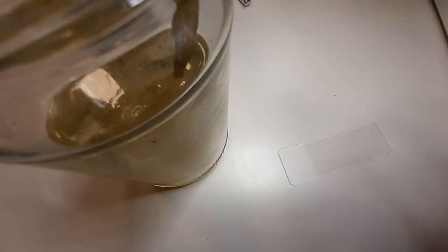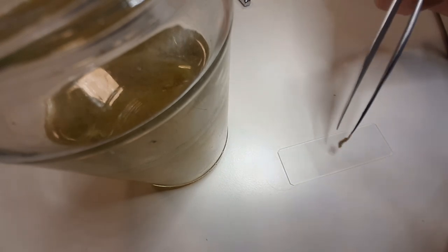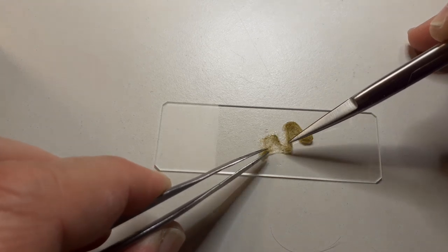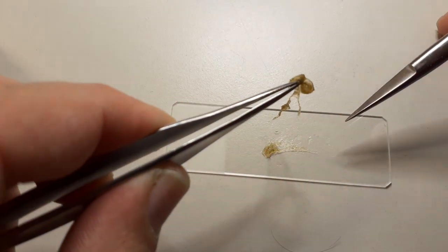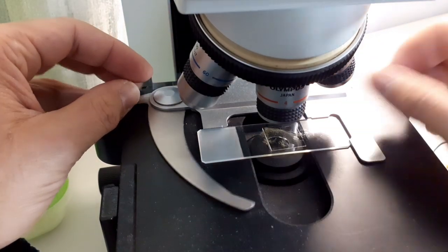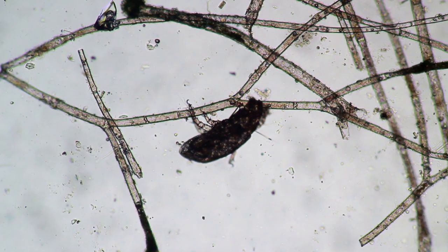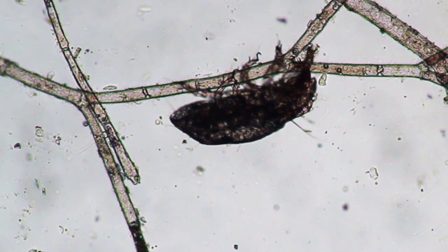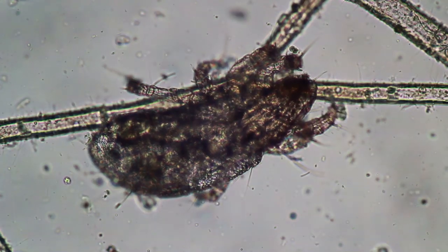I'm going to take a small sample of the algae out, hoping at the same time that there are going to be some mites in there as well. I was lucky, and in this small sample I was able to find two mites — barely visible with the unaided eye, but with the compound microscope it worked quite well. Cover glass goes on top, everything goes directly under the microscope, and it did not take me very long. I immediately saw something moving around, and you can very nicely see that on one side it has four legs — eight legs total, very typical for mites.